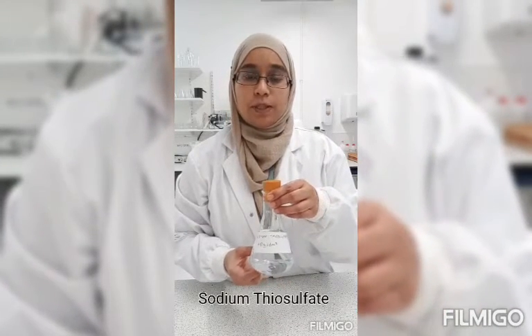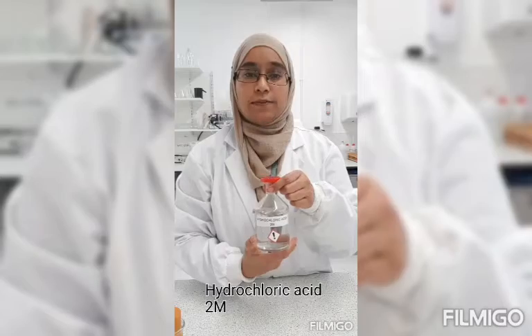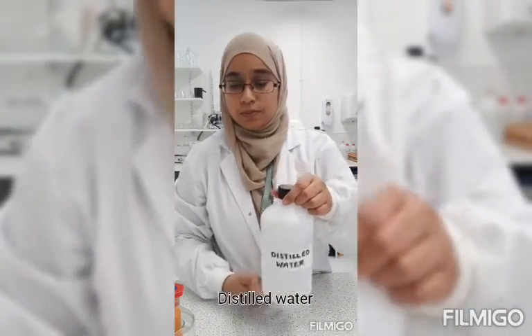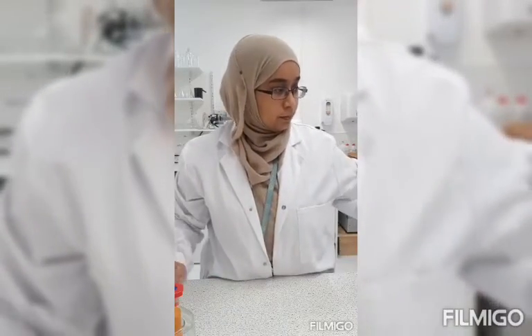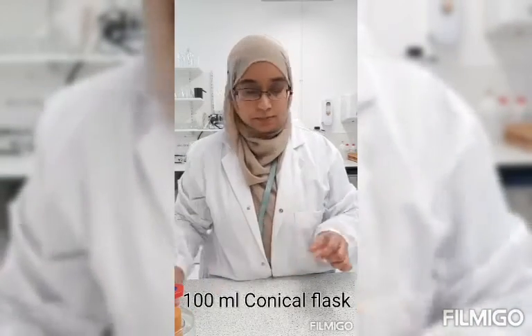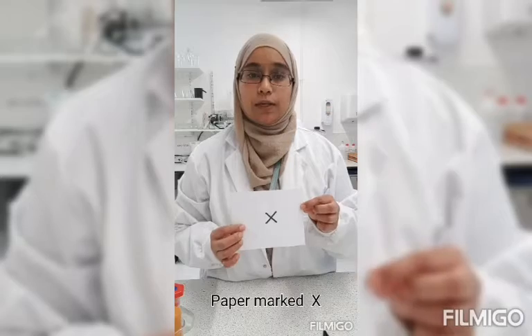I've made some solution of sodium thiosulfate, which is 40 grams per decimeter cube. You will need some hydrochloric acid, which I have 2 molar here. Some distilled water for dilutions. A 100 milliliter measuring cylinder. A 25 milliliter measuring cylinder. A 100 milliliter conical flask. A stopwatch. And a piece of paper with an X marked on it.